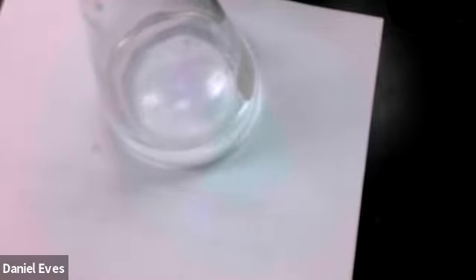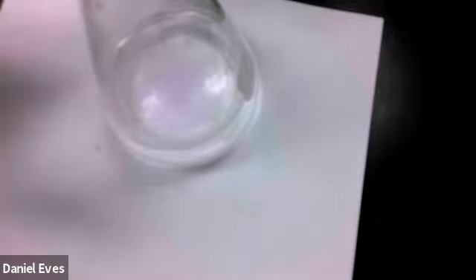We're getting close to the end of our burette again. So we are around 46 milliliters, but we're still waiting for that. Slow down this titch. No, not quite. Getting there. Up a little more. There we go.